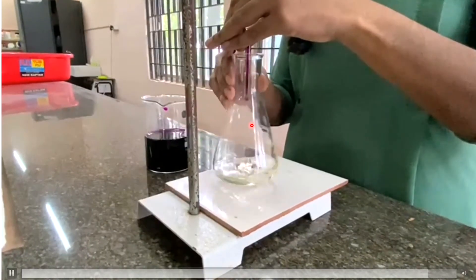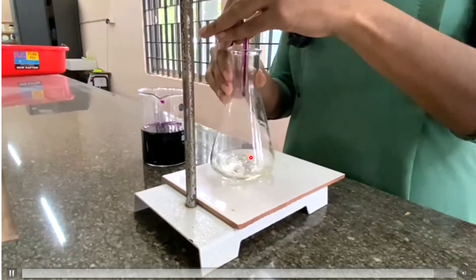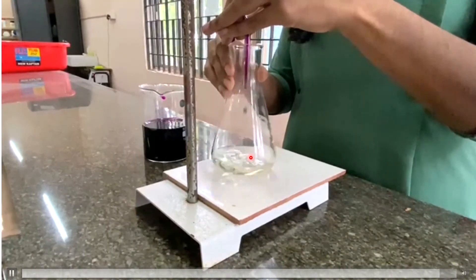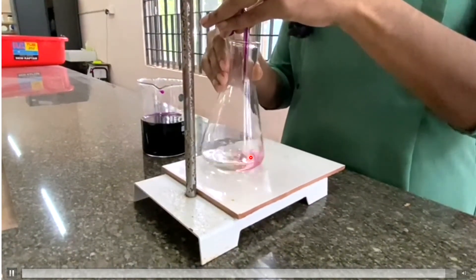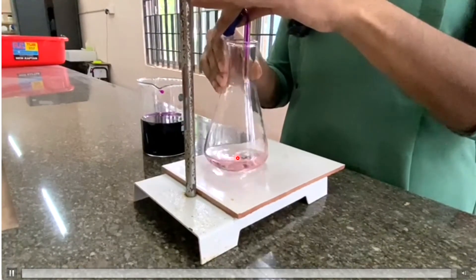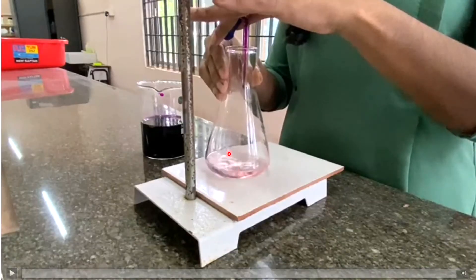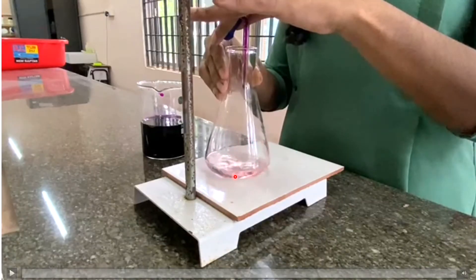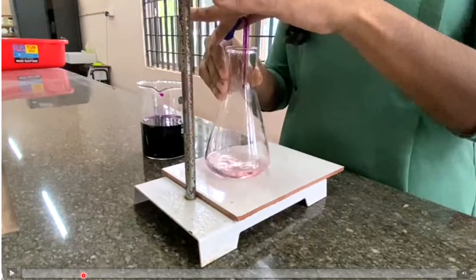Now we carry out the titration. Because the end point is pale pink, we add KMnO₄ drop by drop. We use a minimum amount until we reach the pale pink color. This is the end point of the titration.